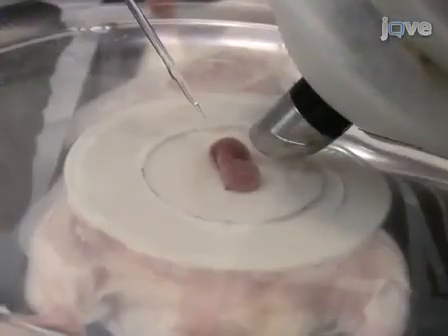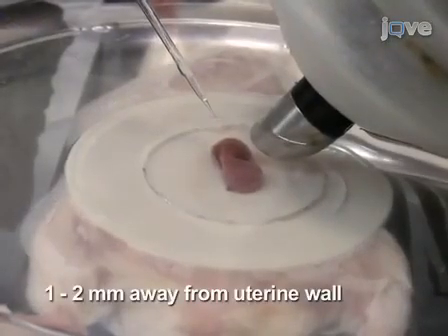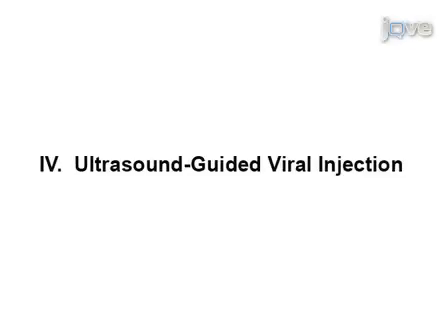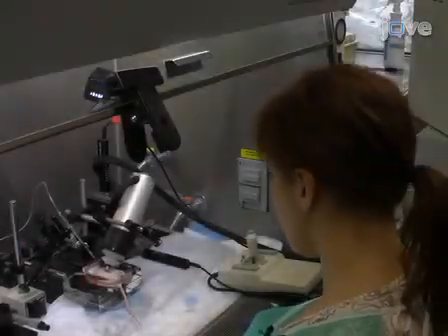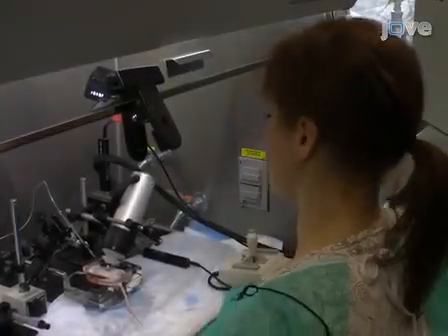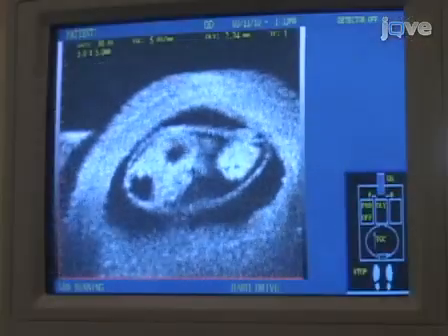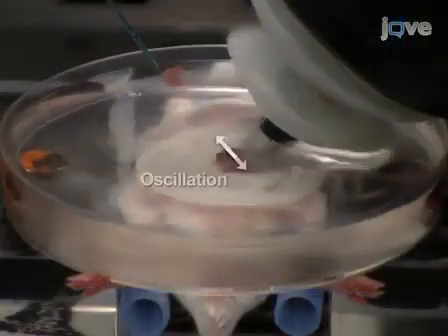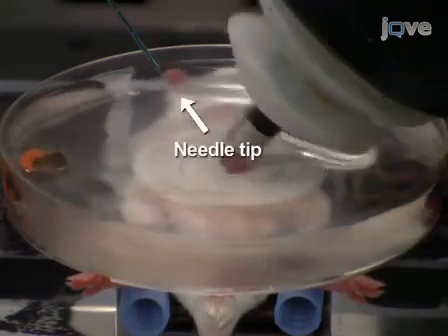Move the injection needle into position 1 to 2 millimeters away from the uterine wall at about a 45-degree angle. Images generated by the ultrasound probe are visualized on a video monitor. The needle tip appears as the brightest spot on the screen. Make sure that the oscillation direction of the probe is parallel to the length of the needle.